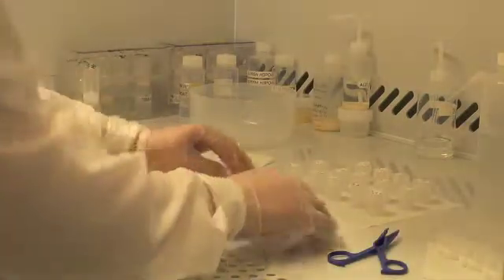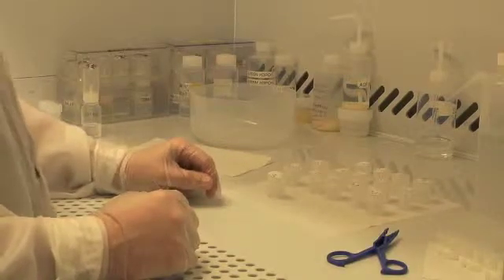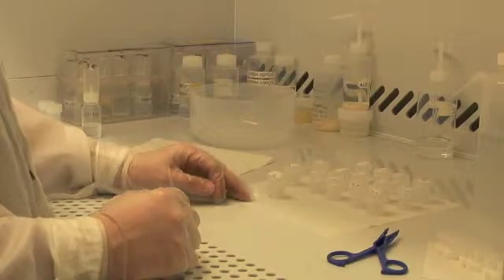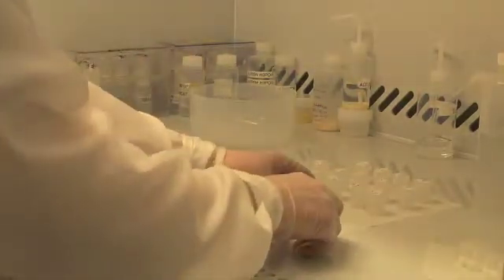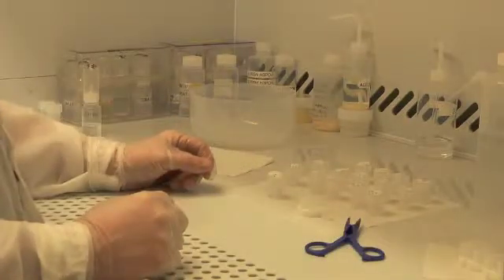We need to rinse out the nitric acid, which is inside the beaker with the zircon. Rinse it several times with clean nitric acid before reloading it back into its corresponding microcapsule for spiking and dissolution.